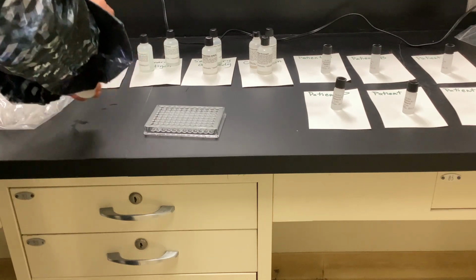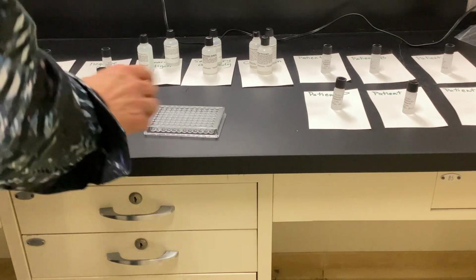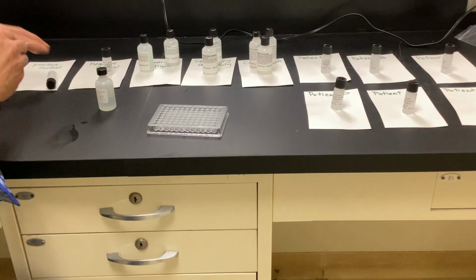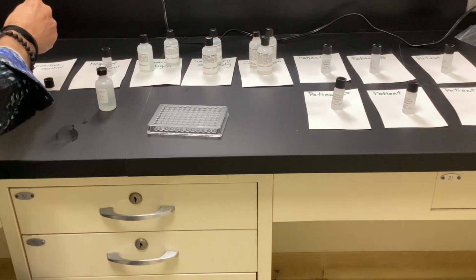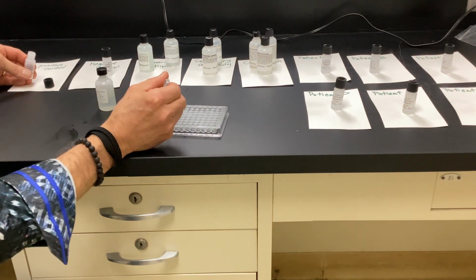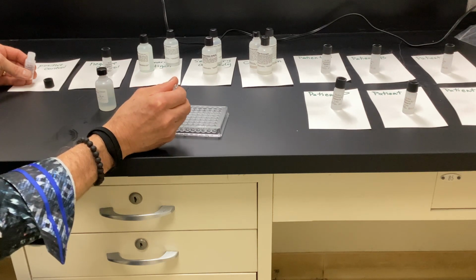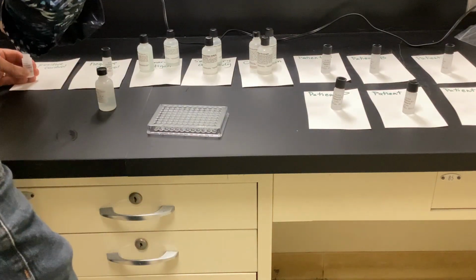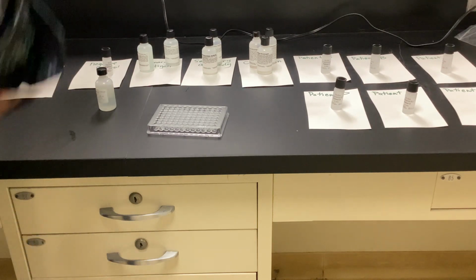All right. What does step 2 say? 3 drops of positive control. Positive control in the first 3. So that's going to be A1, 2, 3, with a fresh pipette. So my positive control is actually the antibody here. All right, so I'm going to do 1, 2, 3. So I'm putting the antibody into the well, but it's not going to show up until I put the secondary antibody attached to it and then the chromogen to it.